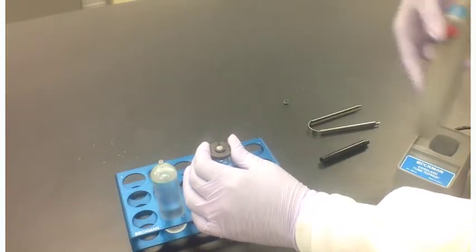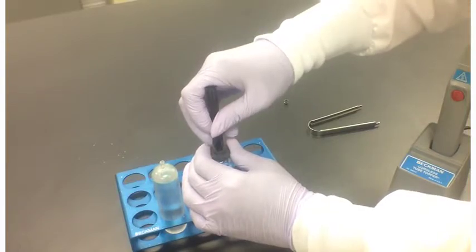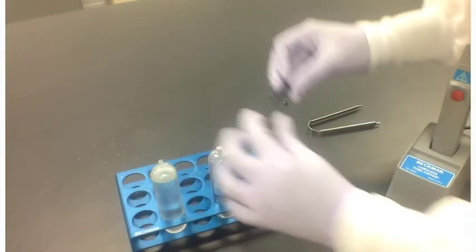Place the heat sink, the small end, over the cap for 2-3 seconds while the plastic cools. Do not let the seal former pop up. If the seal former does pop up, the tube may not have an adequate seal and may need to be resealed.